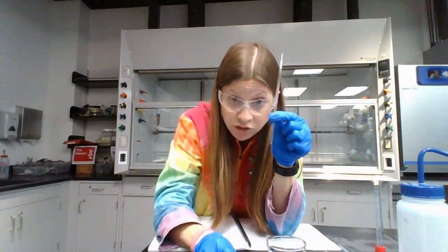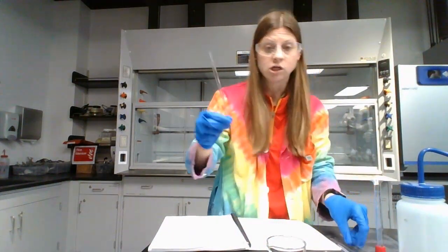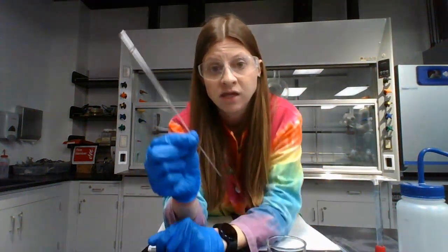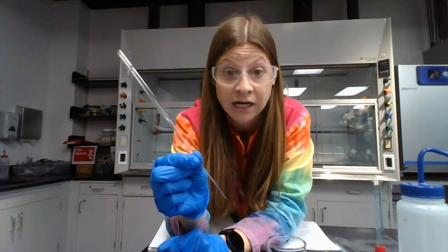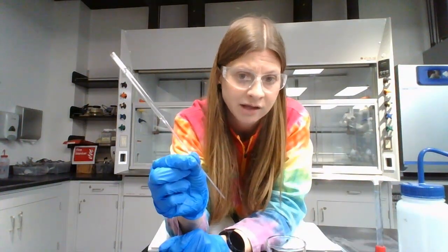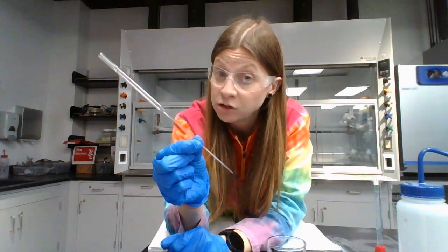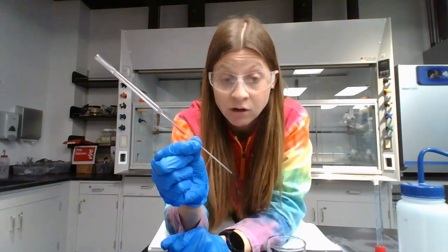So we've got to get our solutions transferred into these NMR tubes. The problem is, again, they're really, really small. You can't pour them in. It's too narrow. So we are going to use what are called pasteur pipettes. These are the pipettes that are used in organic chemistry lab, because in organic chemistry, they can't use the plastic disposable pipettes because organic chemicals dissolve plastic. So they have to use glass. These are disposable. They're one use only. When we're finished with them, we're going to put them in the broken glass box.